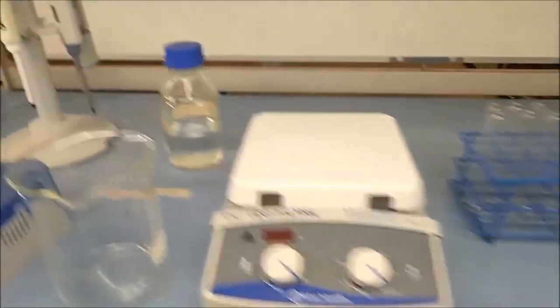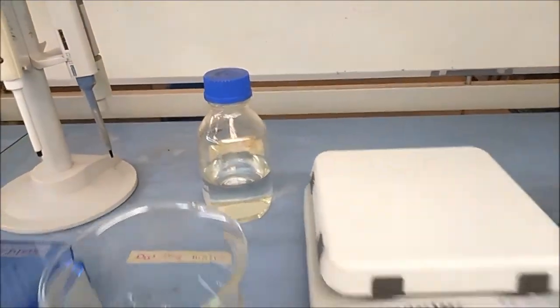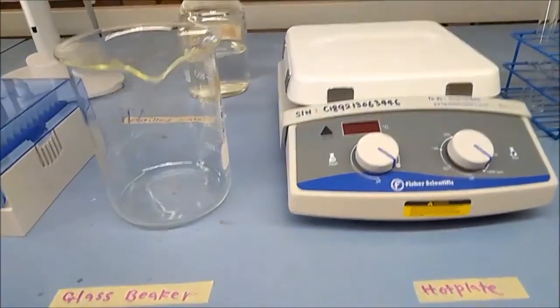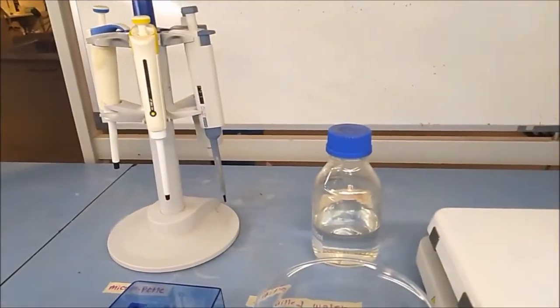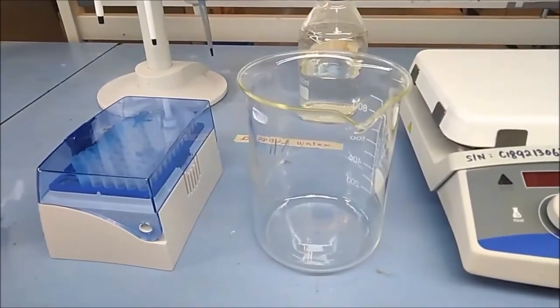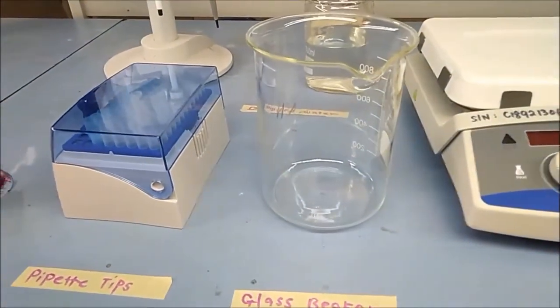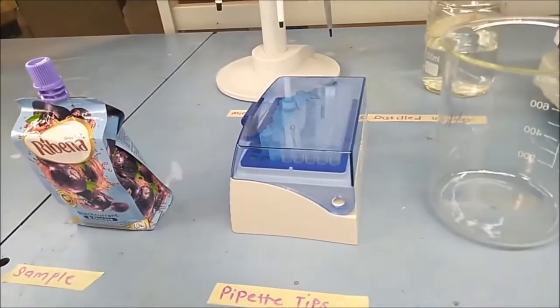hot plate, test tube, glass beaker, micro pipette, pipette tips, and also our sample which is a Ribena drink.